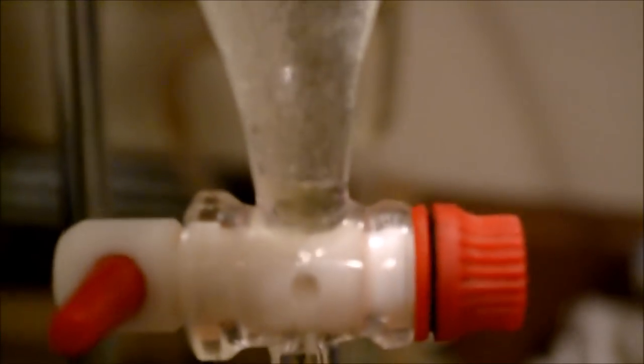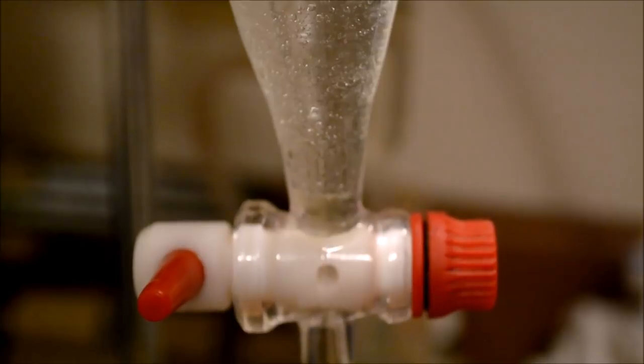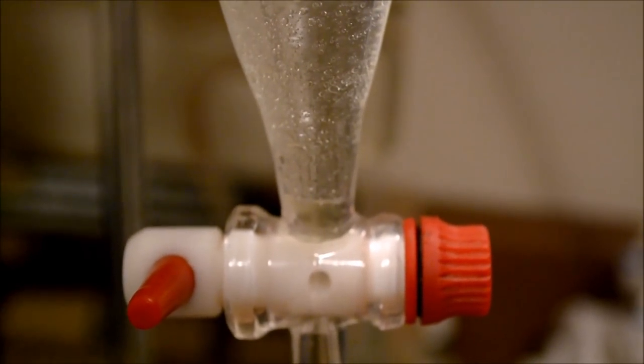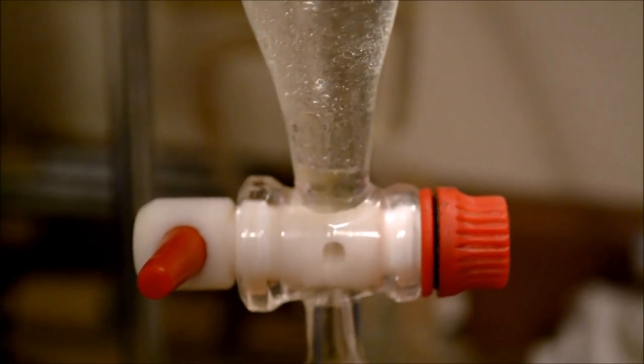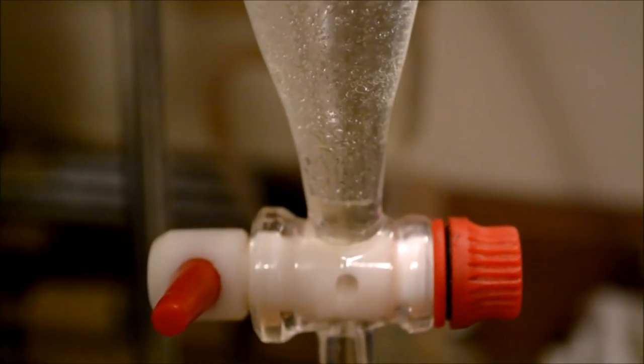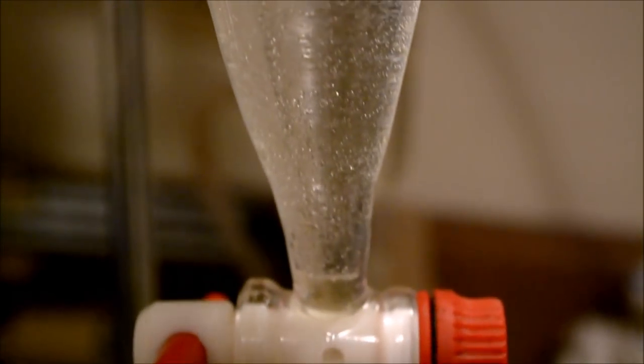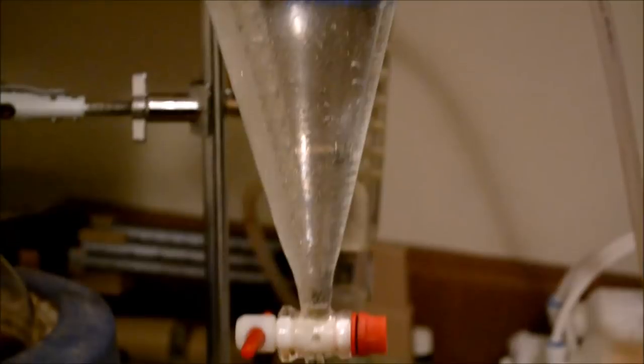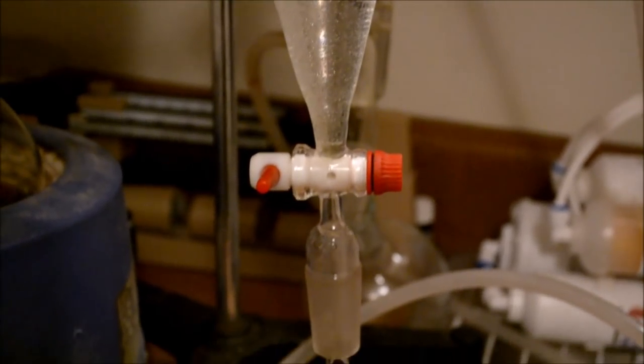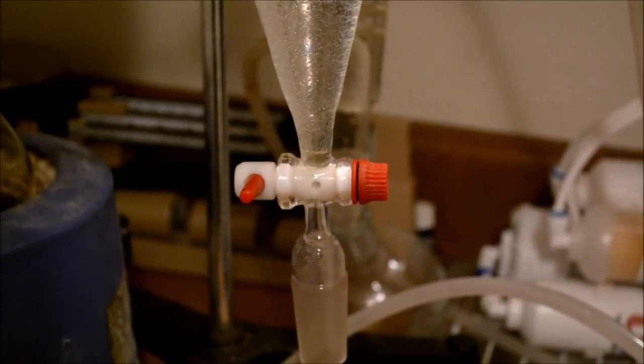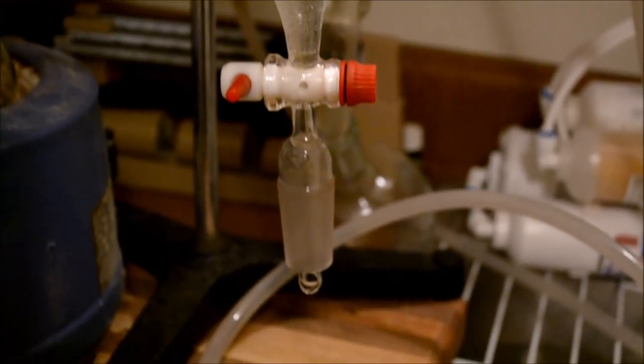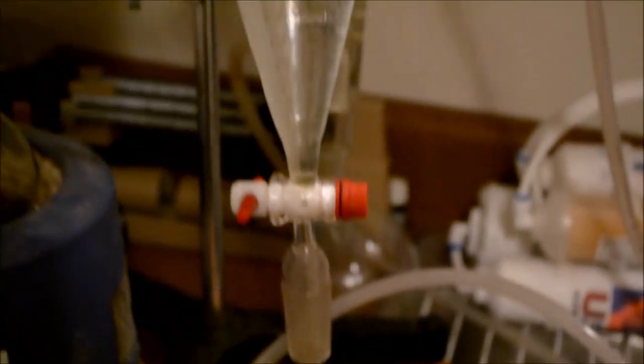And so when separating it out, you want to make sure that you don't get any hydrosol with the oil. We read about that earlier, how hydrolysis can affect some of the constituents of the essential oil. So I'm going to let this sit here for a little bit and completely separate out, then separate the oil from the hydrosol, and it will be ready to use.